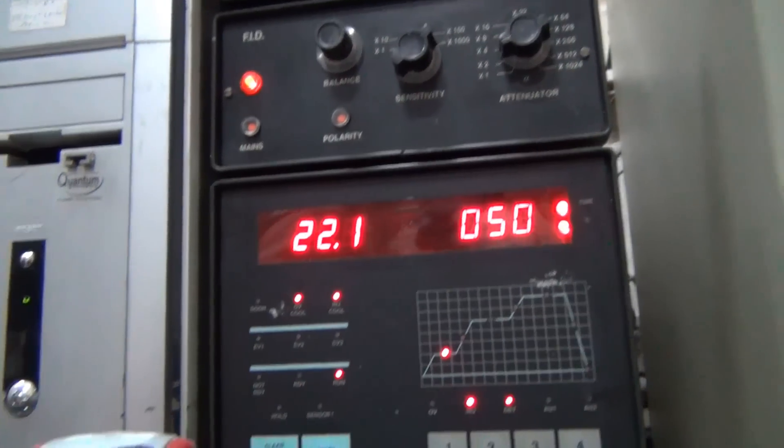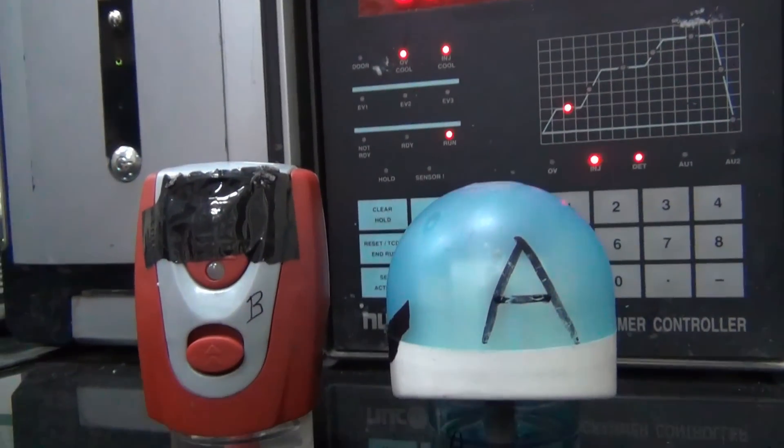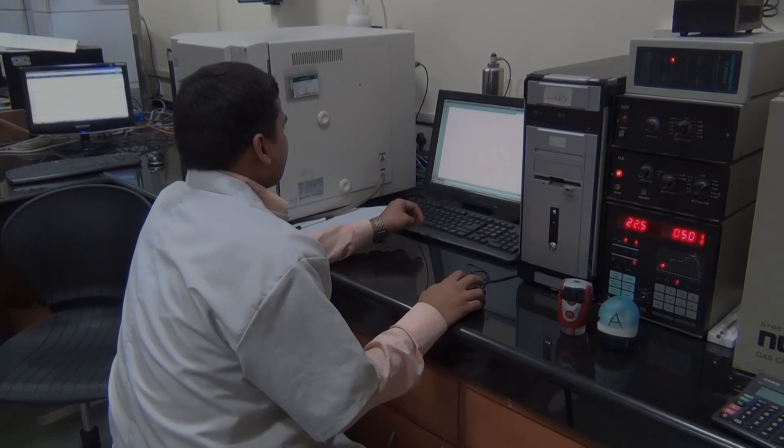After completing the test preparation, we have injected at a particular retention time. After that, we have calculated the results against the label claim. It is less than 1%, which means it is safe for the customer. We have also told you that in any other brand — in any other 5 brands — there is no more chemical content than 1 percent.